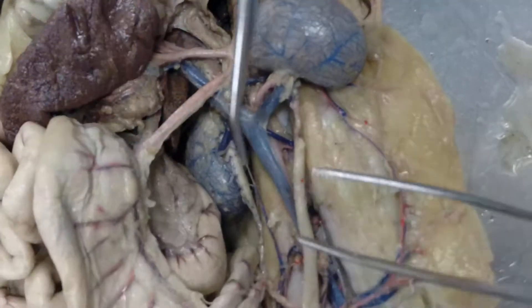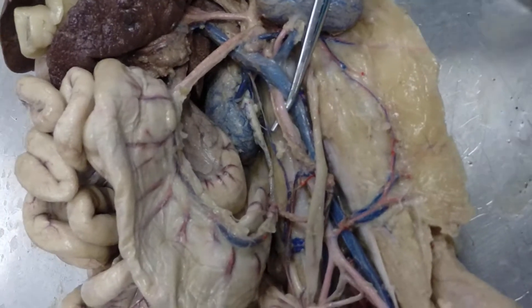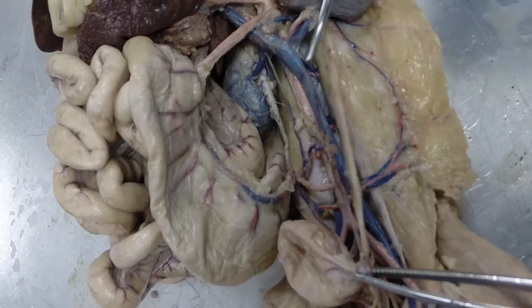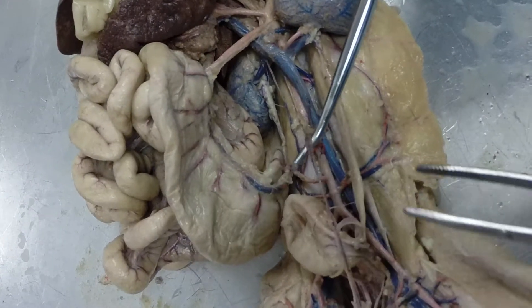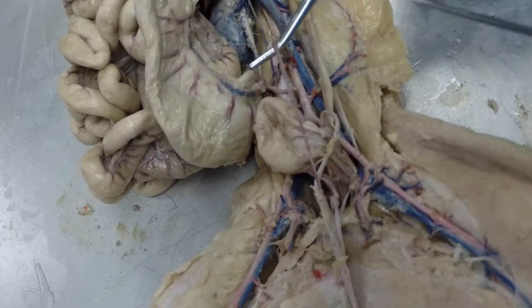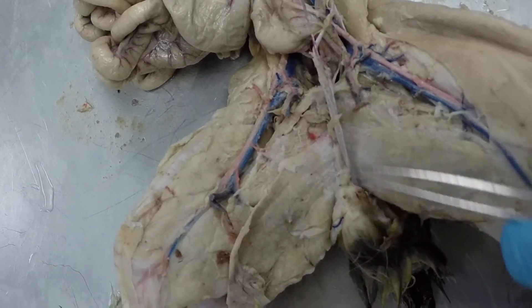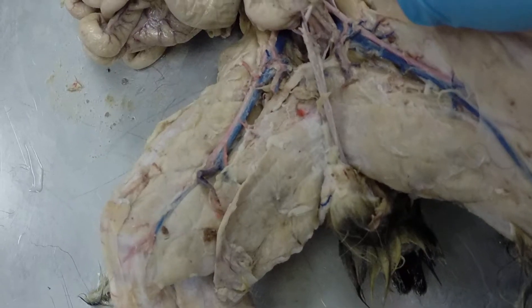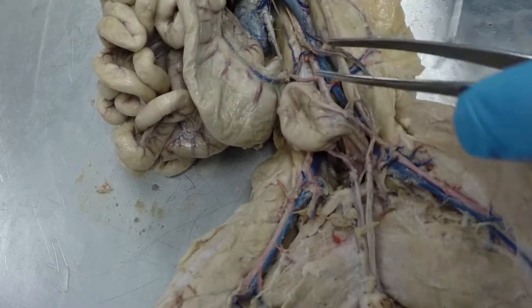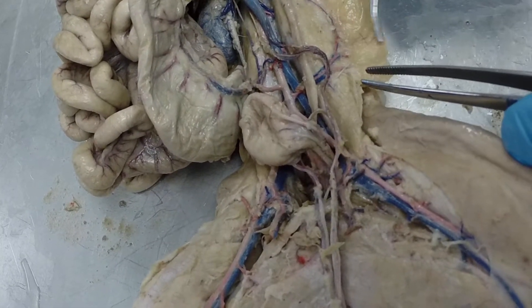Back on the descending abdominal aorta, our next branch is this very delicate artery that I've taken a lot of care to preserve. This is our gonadal artery, and this is a male cat so it's going all the way down into the spermatic cords and then down to the testes — this is our left gonadal artery on the male. If this was a female, this delicate artery would go straight across to the ovary.